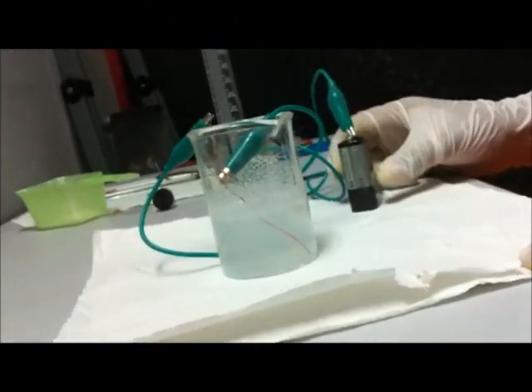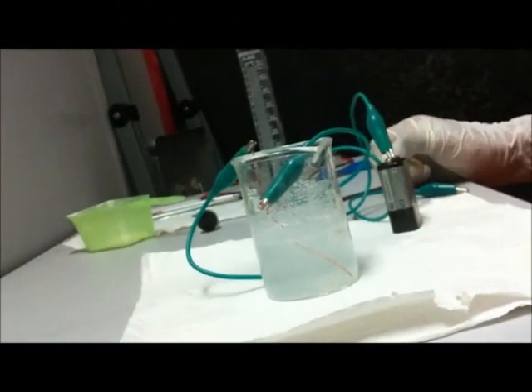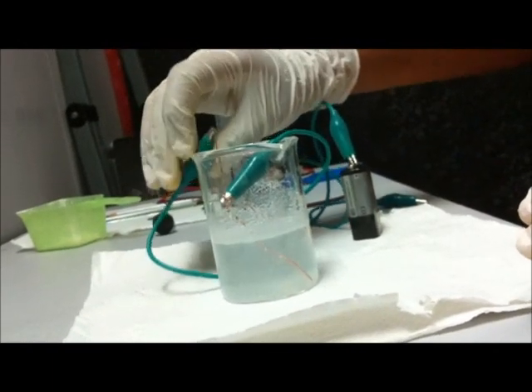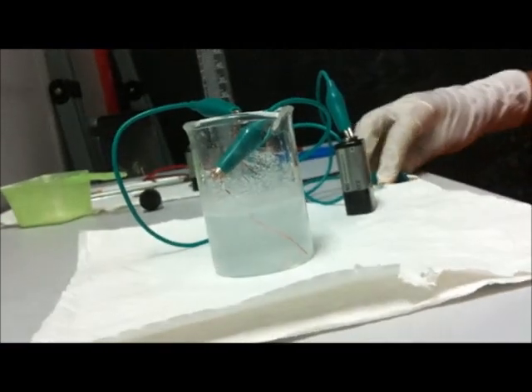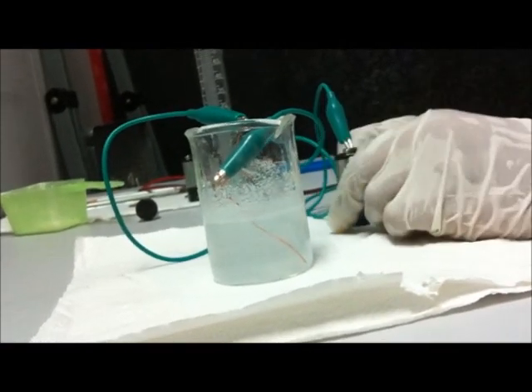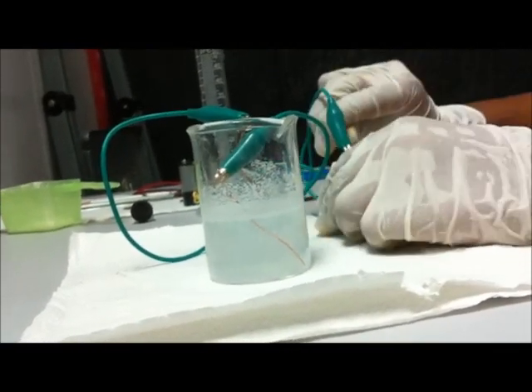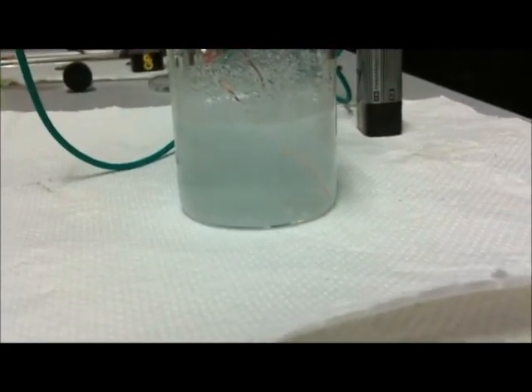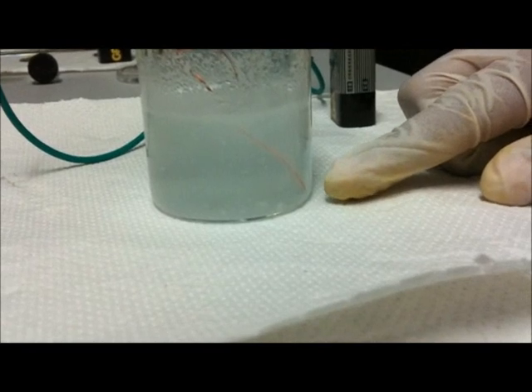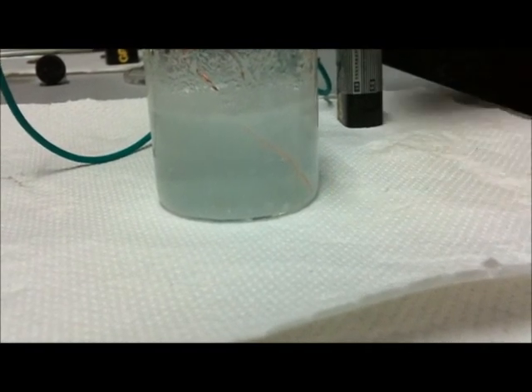You may notice some changes in our reaction vessel. We changed the battery since it was dead, which we later found out. Then we changed the electrodes to copper wire as they are more reliable and contain almost 99% copper. The positive terminal is connected and connecting the negative terminal of the battery.